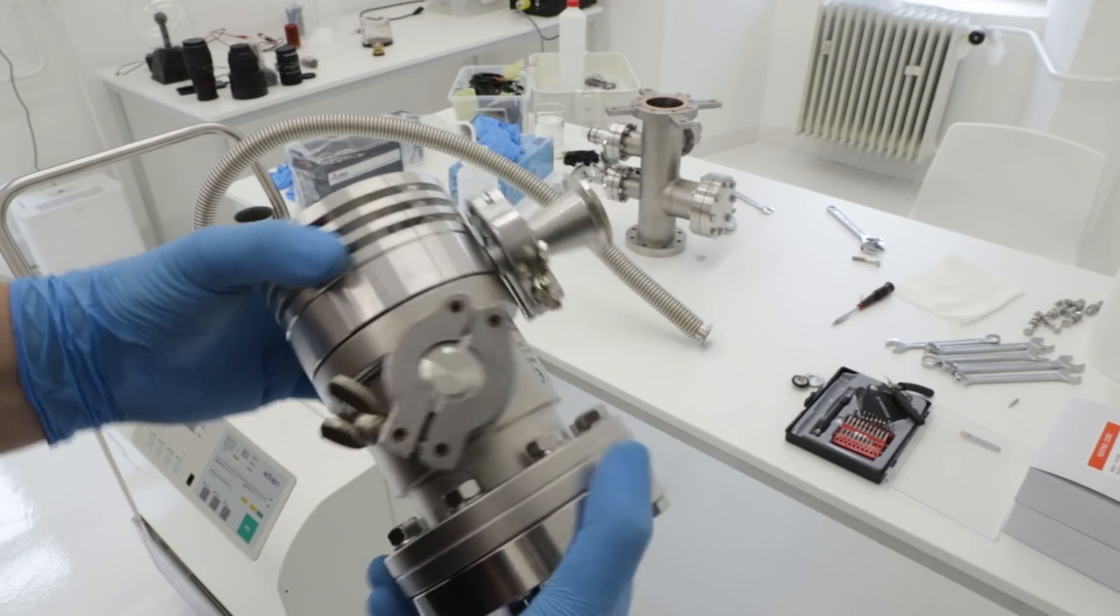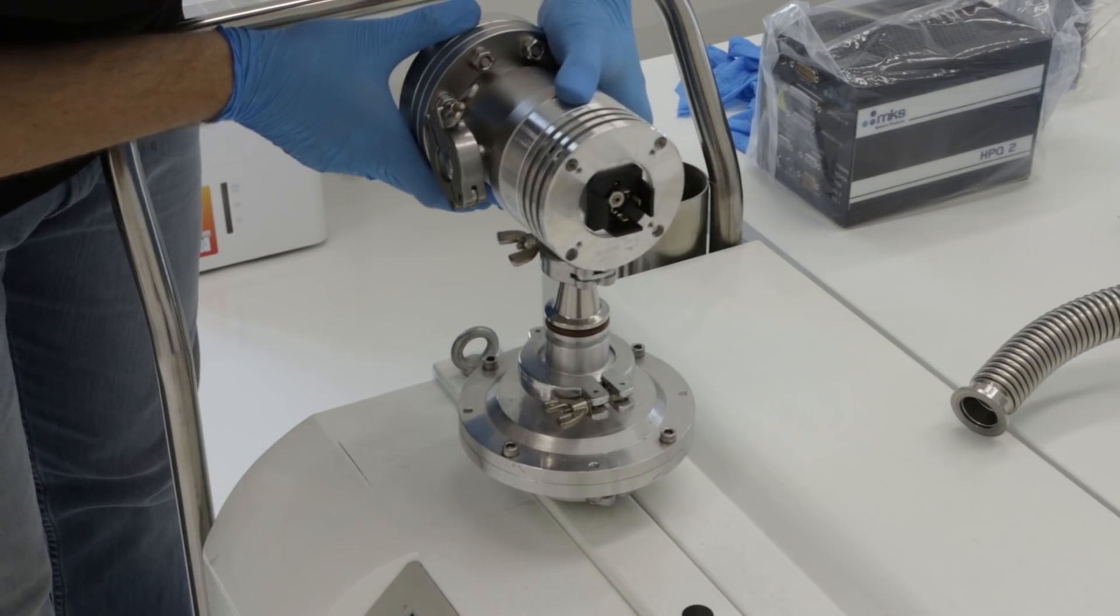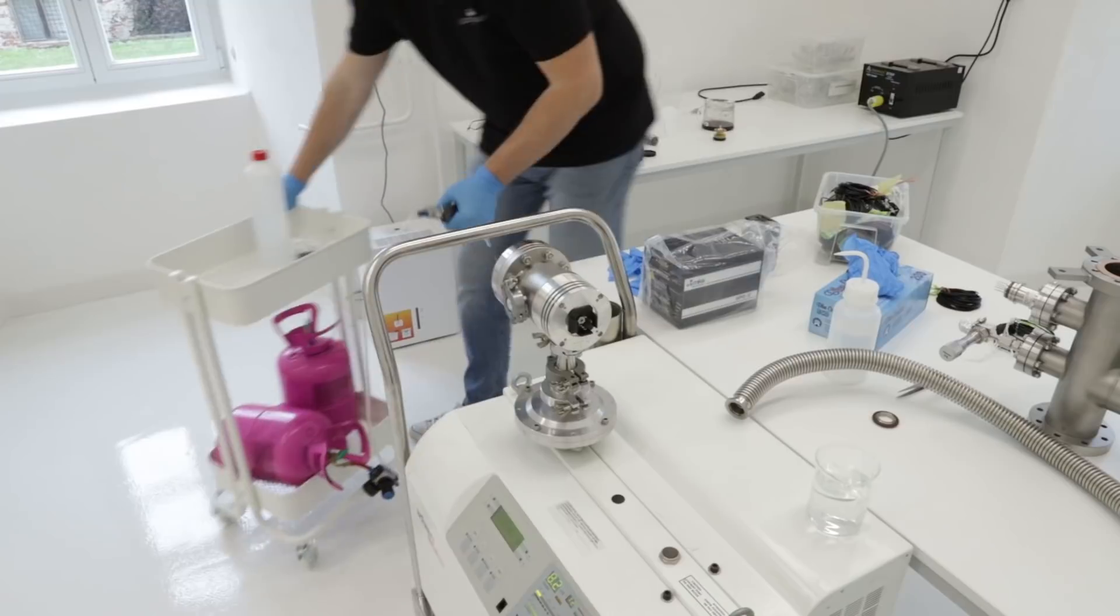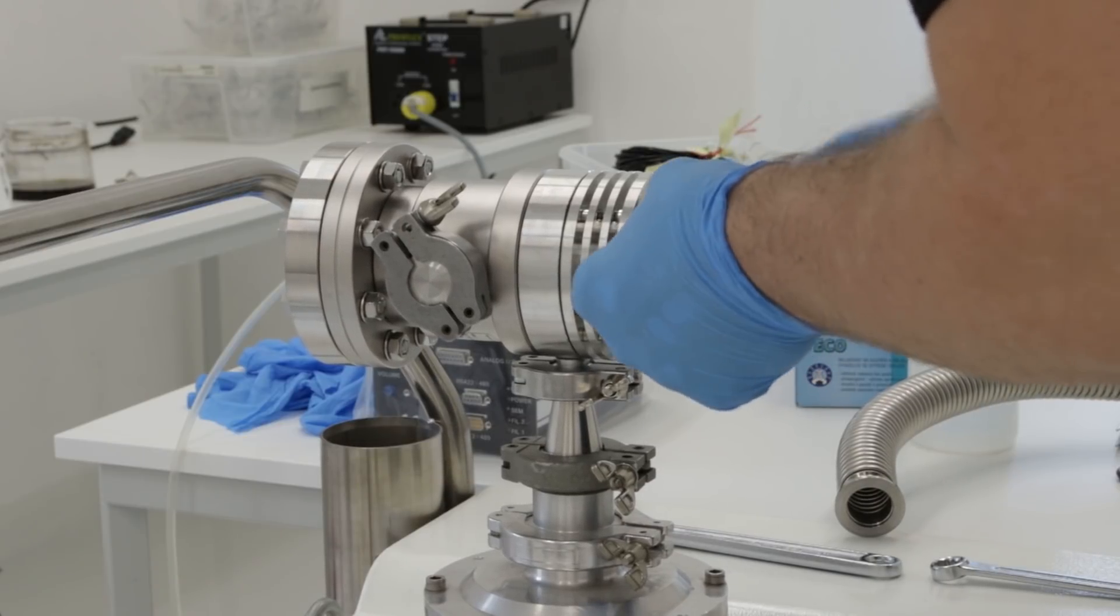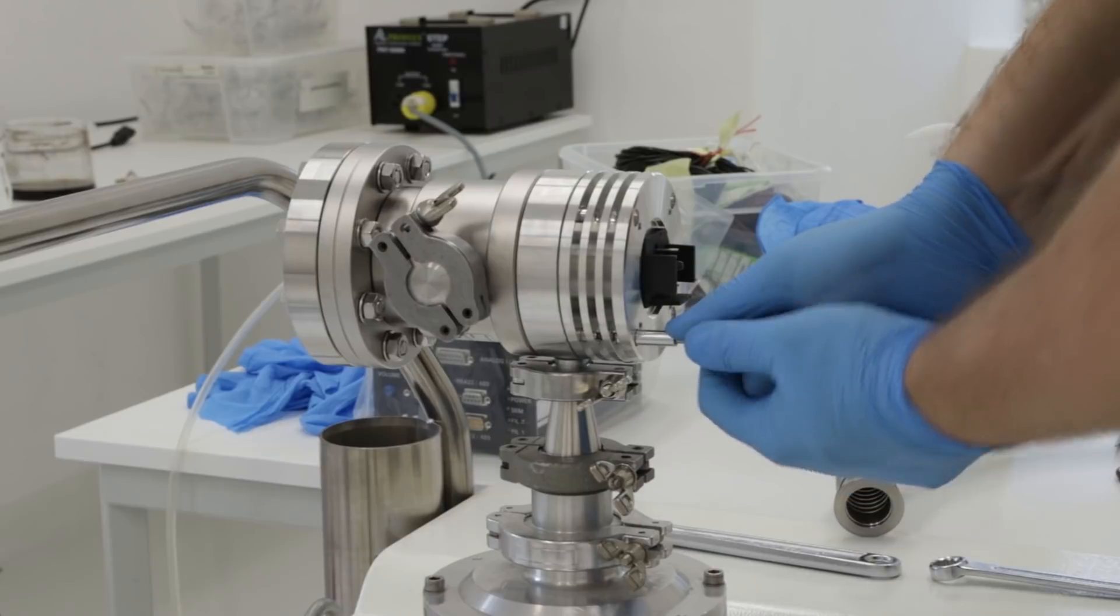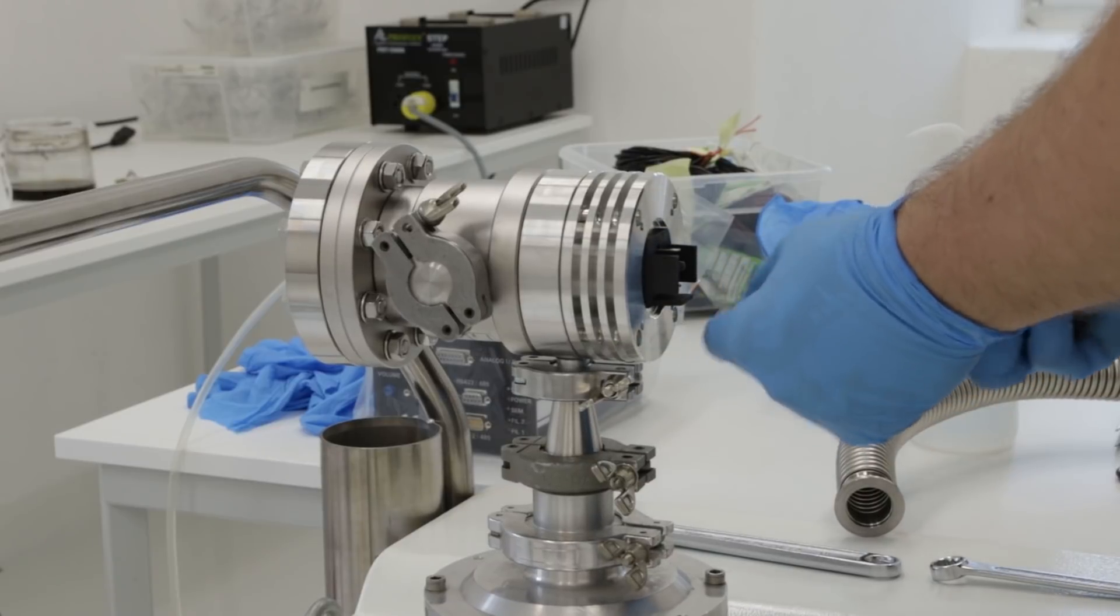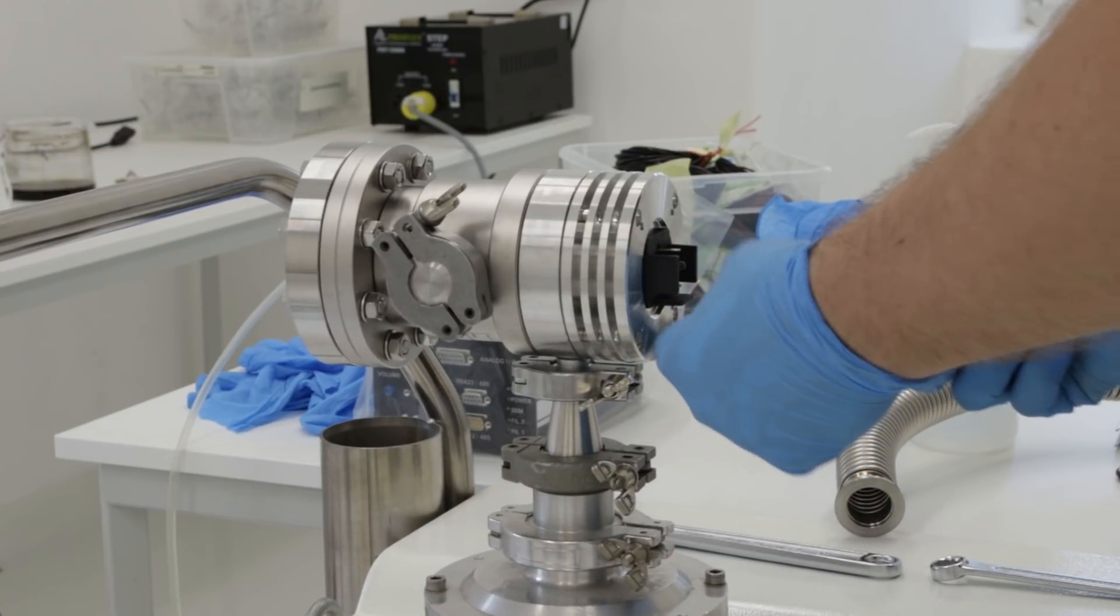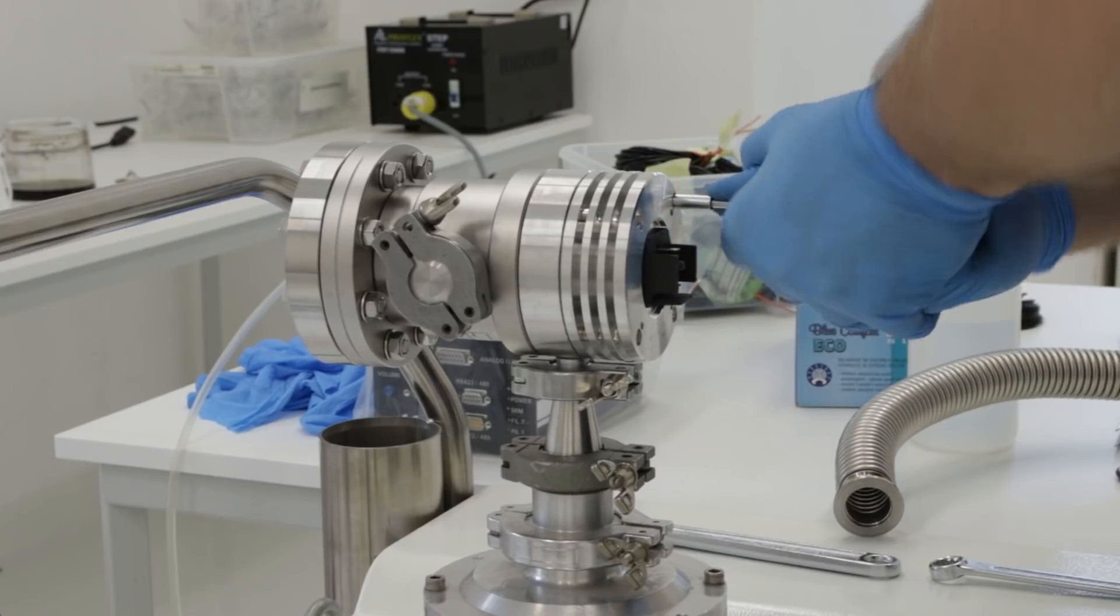What we got is a minimum chamber which will be much easier to test for leaks. So I will take this and put it on the leak detector, and at this moment when I was tightening the screws to put more pressure on the o-ring inside, I found the problem. Listen to the tone. It's fluctuating when I'm putting pressure on the screws, which means there's a connection opening and closing with applying pressure on the screws.